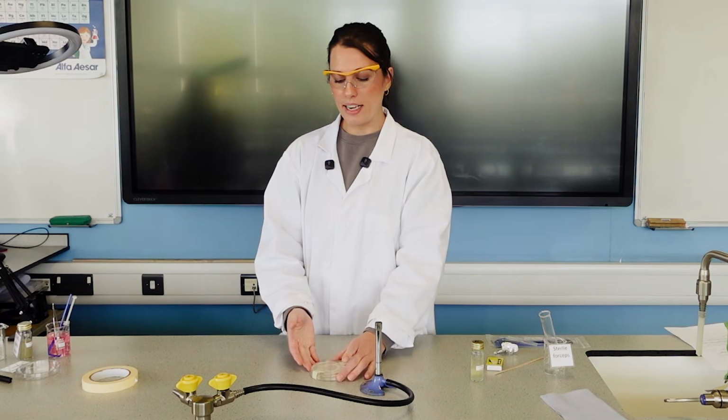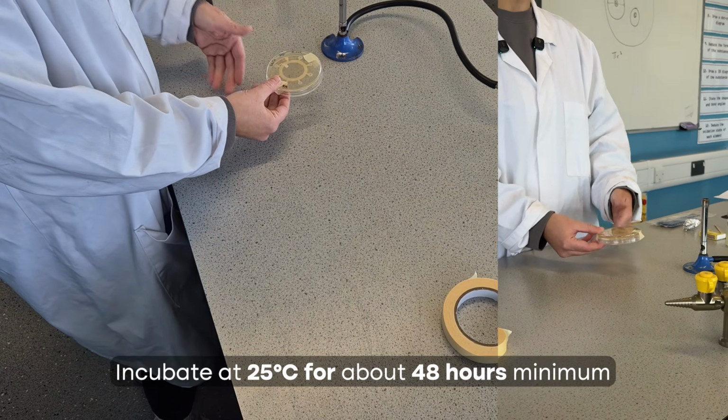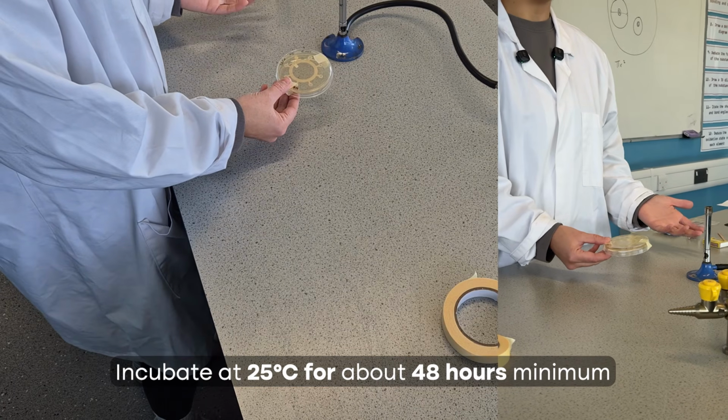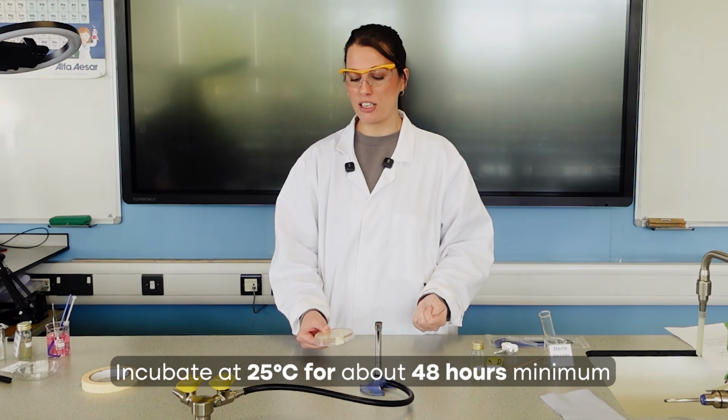And that is our plate ready made to now go to be incubated at 25 degrees C for about 48 hours minimum and about 1 week maximum. Otherwise you'll have too much growth and it could be potentially harmful.